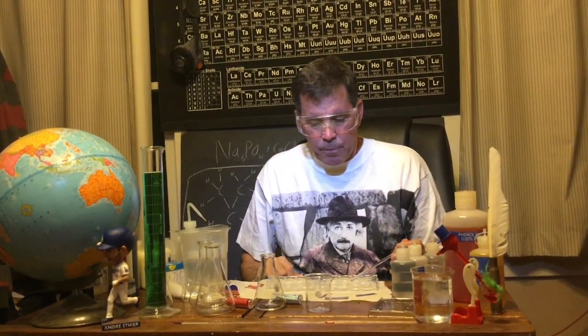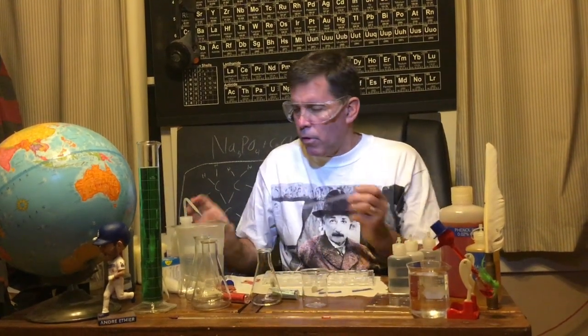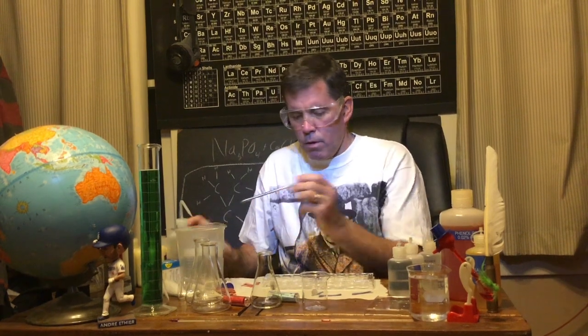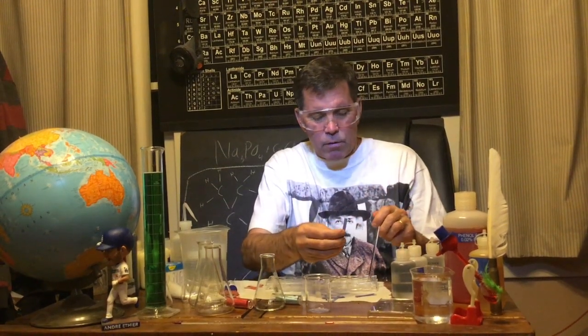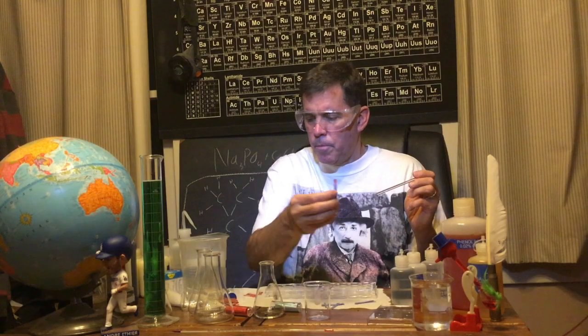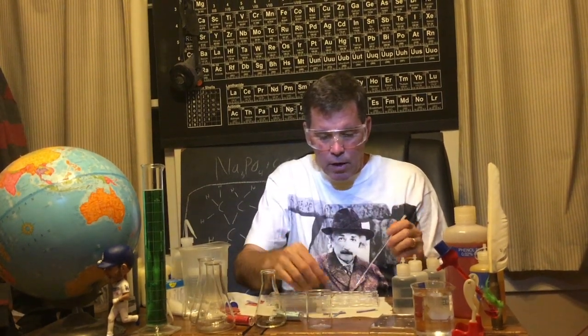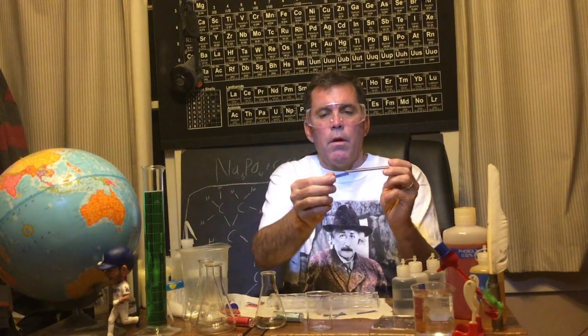Okay, well, what happens if we use blue litmus paper? We've already seen what acid does to blue. So here I have blue litmus. I'm going to start it with the acetic acid. Can you see what happened? Were you surprised by that, or did you expect that? Okay, that was acetic acid. Let's try hydrochloric acid. See?